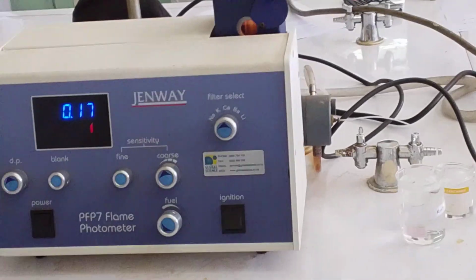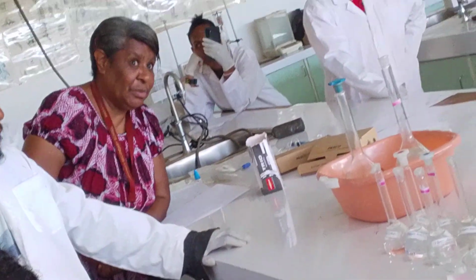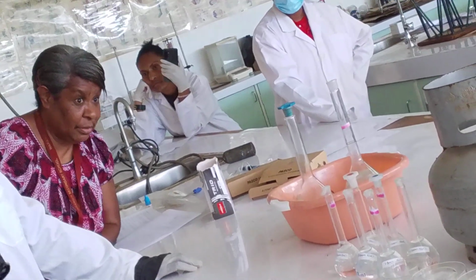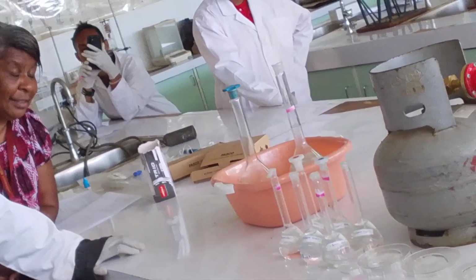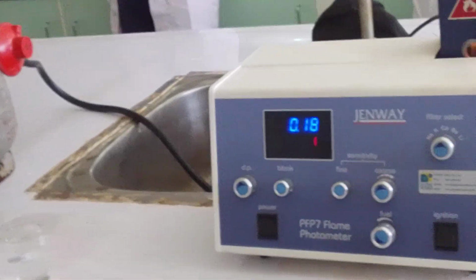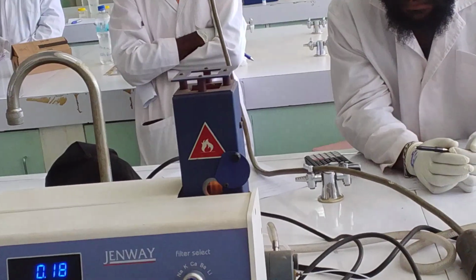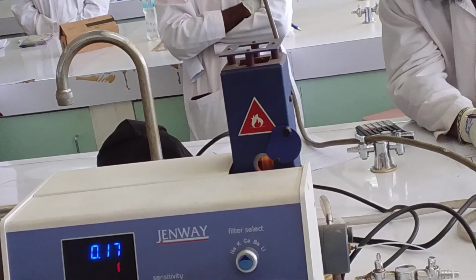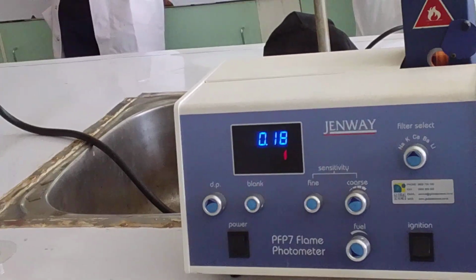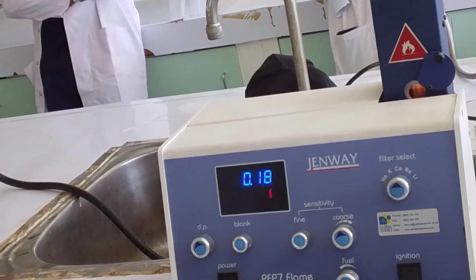Interesting. You're learning something. Like with organic solvents. Extraction. So can organic solvents be used as blanks? Yes, you can do that. You can use solvents as blanks too. The solvents will not be used directly. You make the solvent into a solution before having that mixed with the sample.